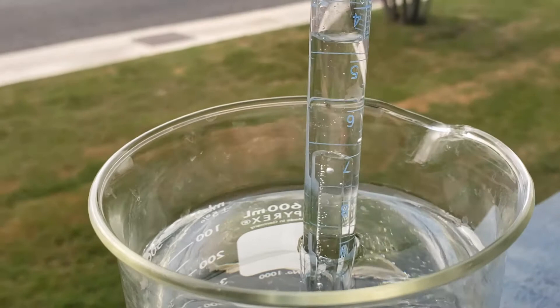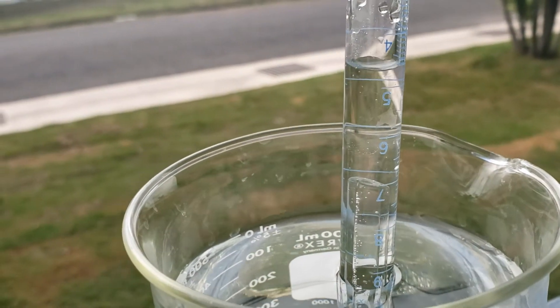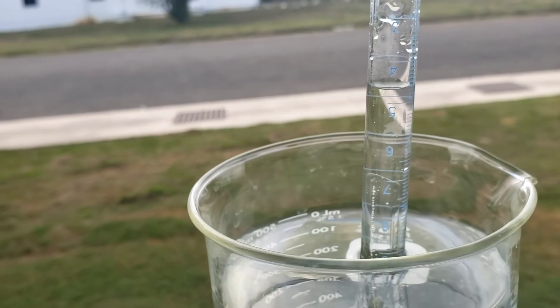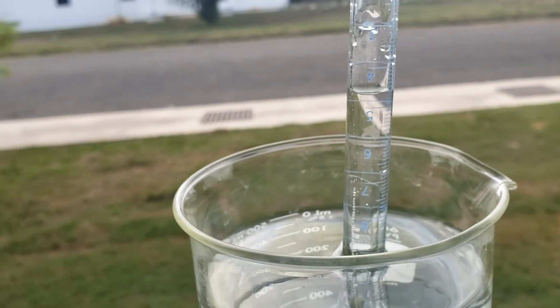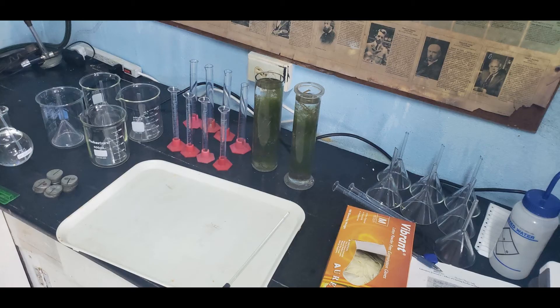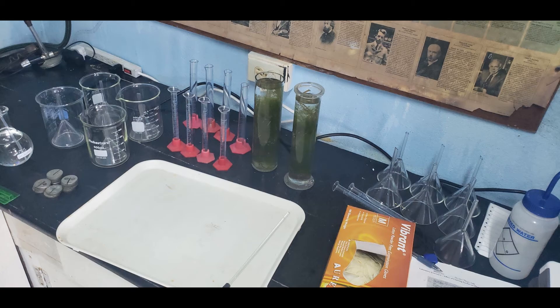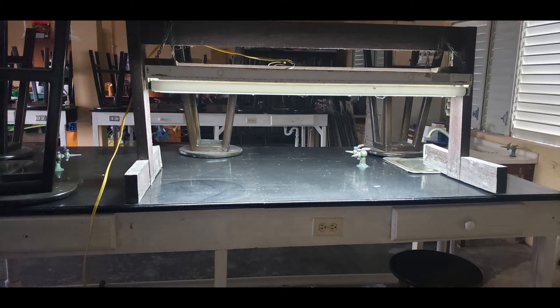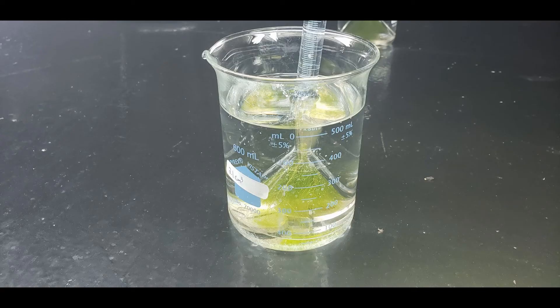Now we'll take five similar apparatus set up, and instead of manipulating the light intensity, what we will change is the concentration of sodium bicarbonate added. From the results, you're going to plot two graphs: one comparing how light affects the rate of photosynthesis, and the other comparing how concentration affects the rate of photosynthesis.